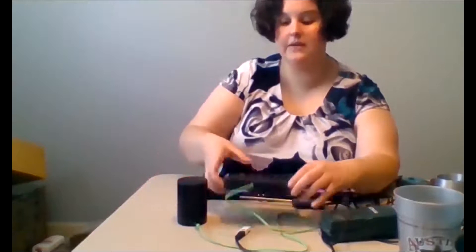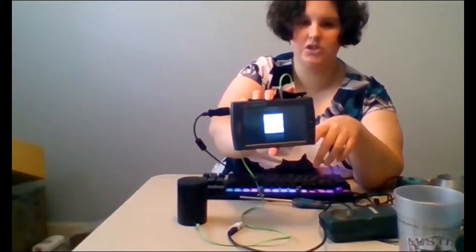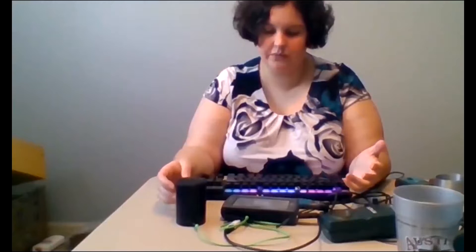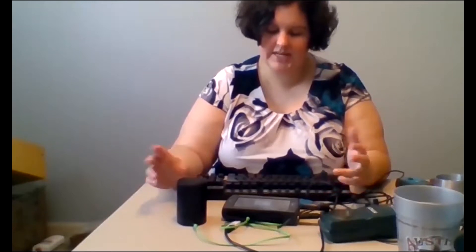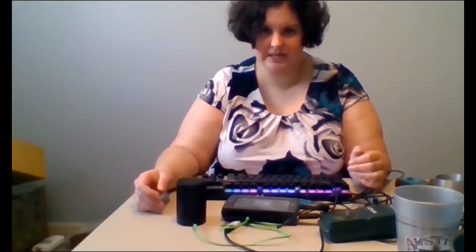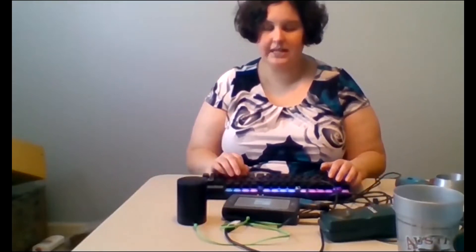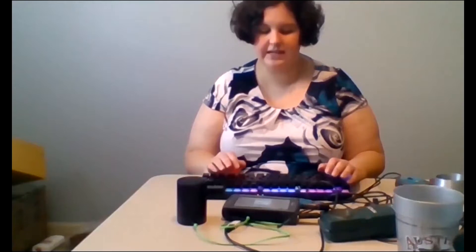When the device first turns on, if you have any residual vision it shows a little graph picture; otherwise you need to wait approximately 40 seconds before you hear it turn on. There is also a standby mode so you don't have to wait for a complete shutdown every time. The device announces: 'Stopping LabQuest version 2, starting LabQuest application, please wait.' From that intro screen, it takes approximately 30 to 45 seconds to load.